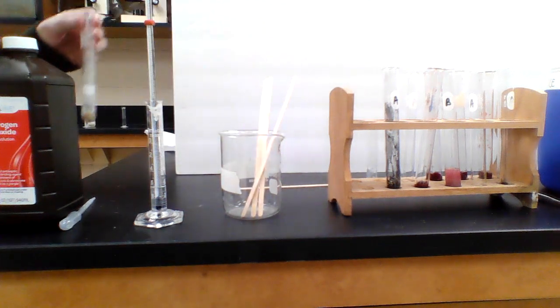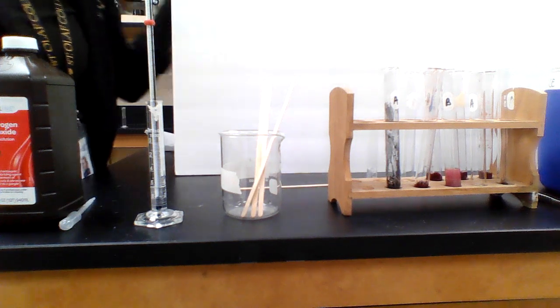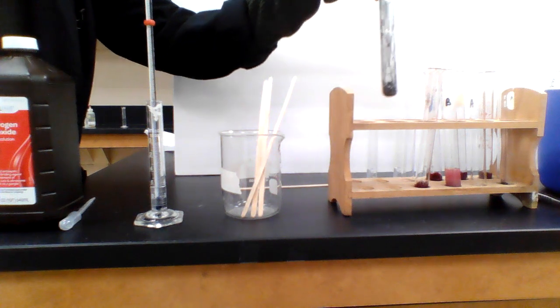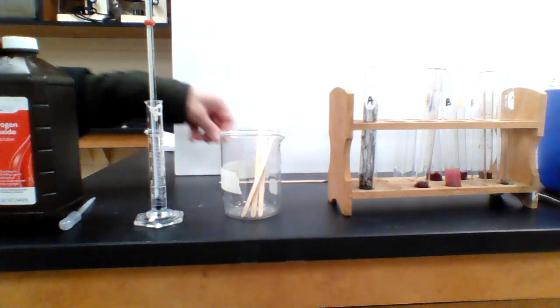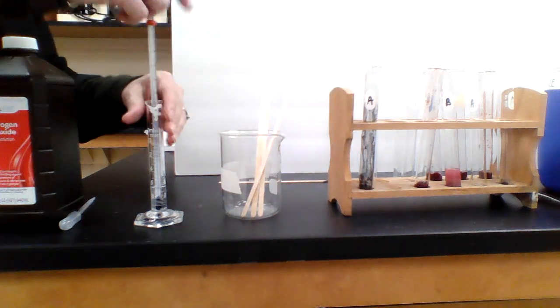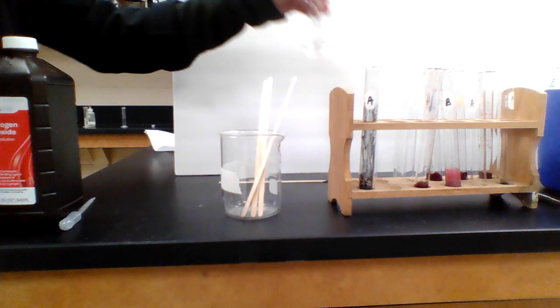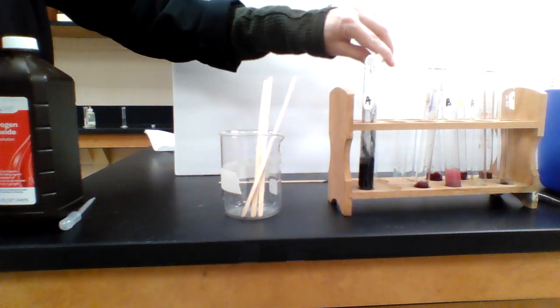So we'll get rid of that particular test tube because that did not work very well. All right, let's try the next one. The next one is that manganese dioxide I was telling you about. It is a catalyst. It's a chemical that we find in the earth, and it's something that we make gunpowder out of. The starting temperature, again, remember, will be 26 degrees. I'm going to go ahead and pour the hydrogen peroxide in.